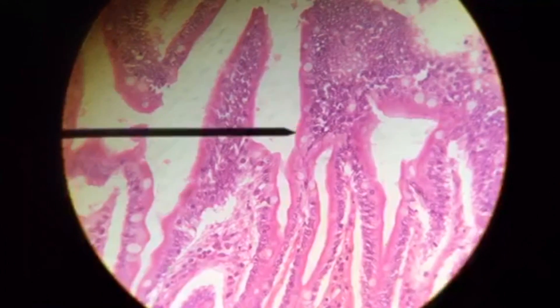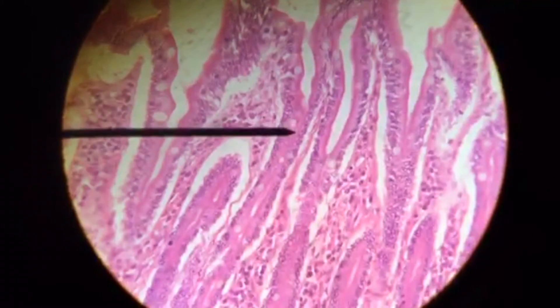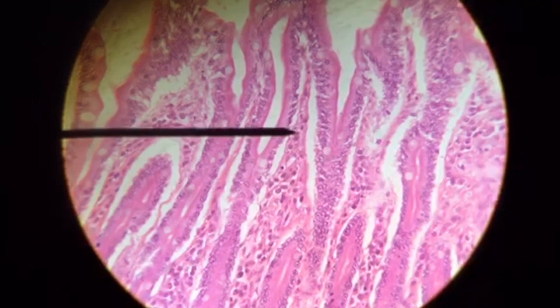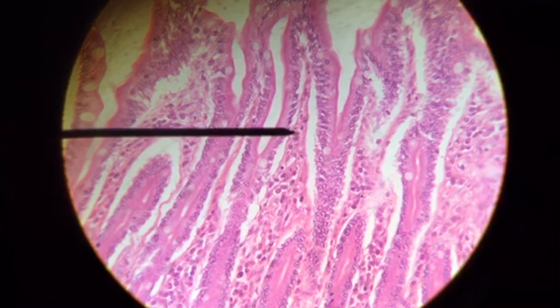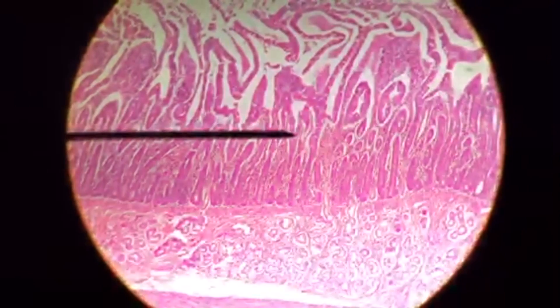You can see the microvilli, or brush border. The pointer is going to move to within that villus, and we're going to see our lacteal. The function of the lacteal is to absorb dietary fat, and remember, this is part of our lymphatic system.